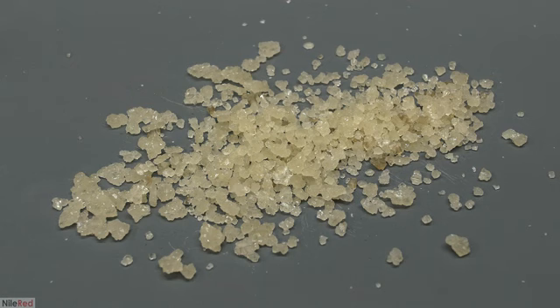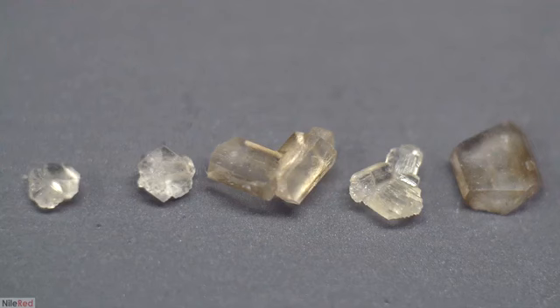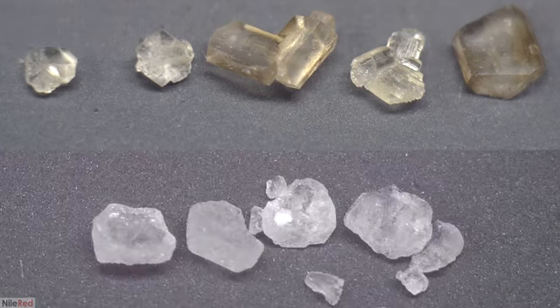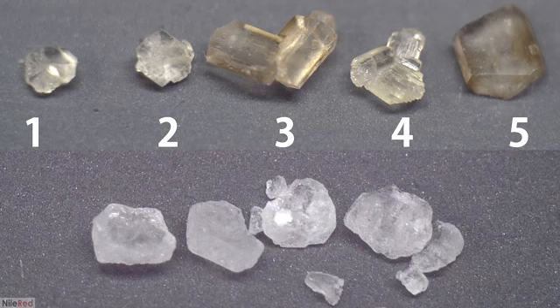Just for fun now, I'm going to take a closer look at the crystals. Using a crappy and cheap lens that I got a few years ago, I was able to get some decent shots. These are 5 crystals that I picked out and lined up, and you can see that their structures are quite different. I've also gone ahead and taken a shot of pure citric acid. Crystals 1, 2, and 4 look very similar to pure citric acid, but crystals 3 and 5 are quite different.